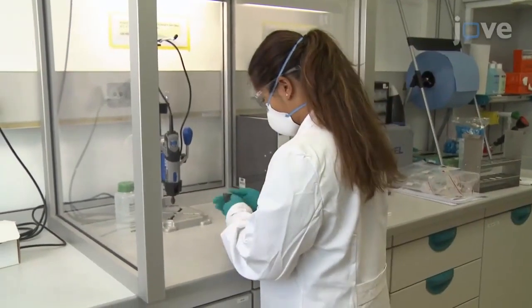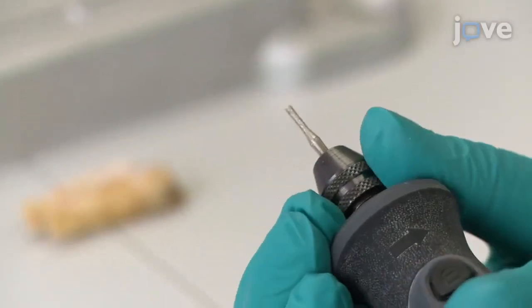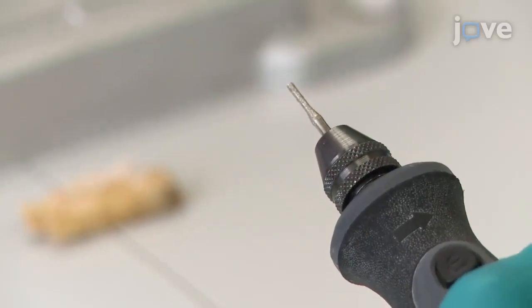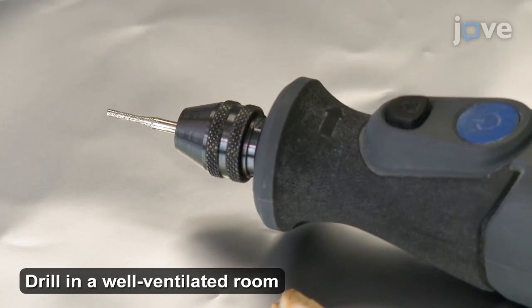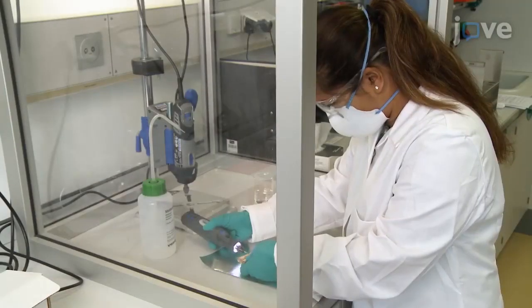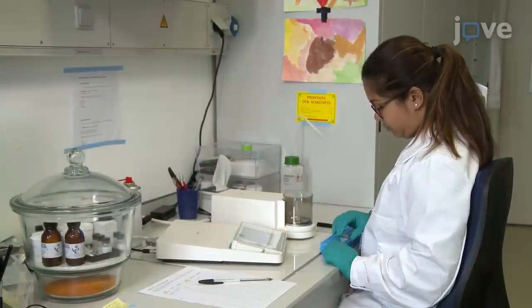To begin bulk sampling, set up a handheld drill as outlined in the text protocol with a clean, diamond-tipped drill of even shape attached via a chuck to the drill setup. Using the drill, clean the outer surface of the tooth by gentle abrasion.